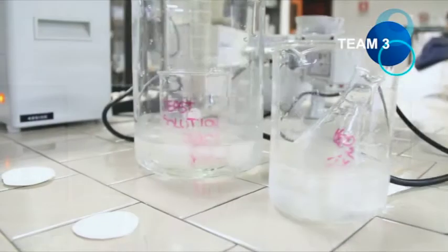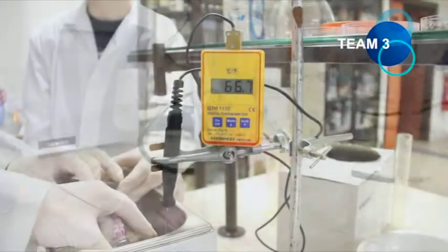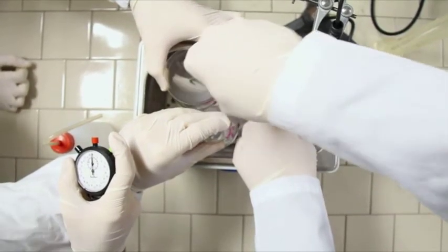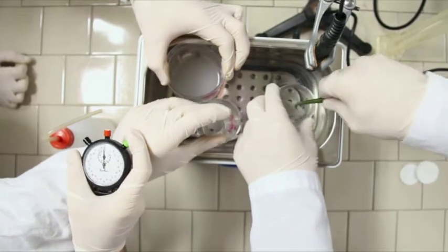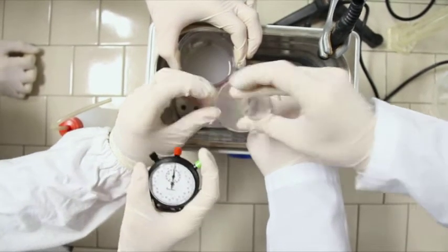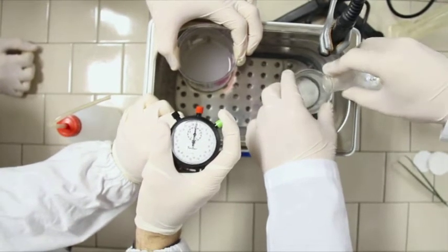We finally focused our attention on the temperature from 5 to 70 degrees, keeping constant hydrogen peroxide and yeast concentration. We must be sure that all the reagents, yeast and hydrogen peroxide, are at the same temperature. We use this thermostated water bath and some ice for the lower temperatures.